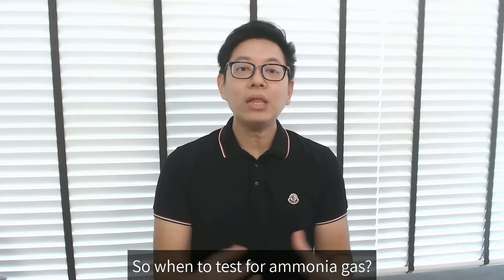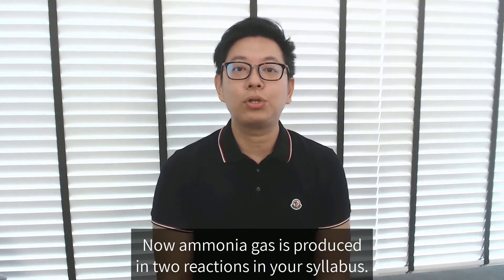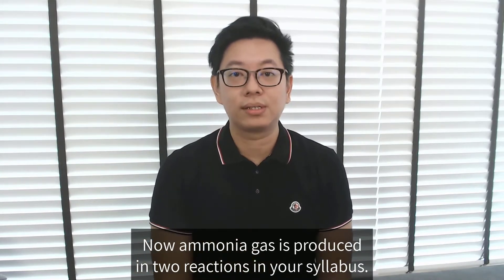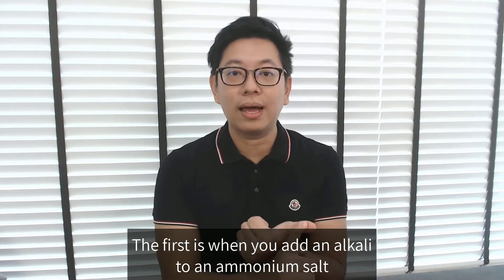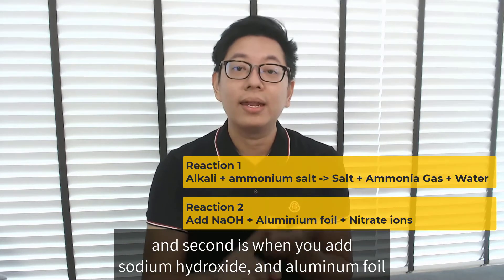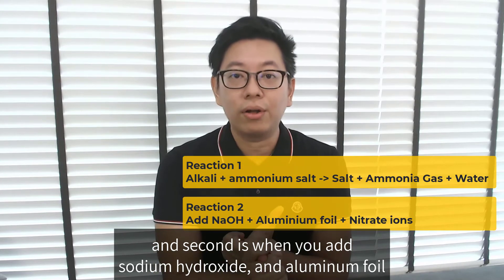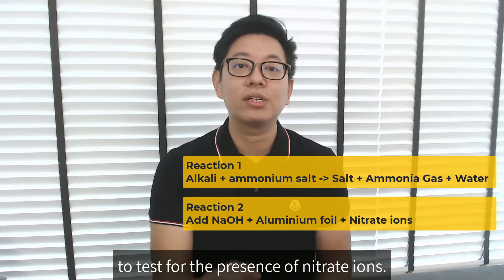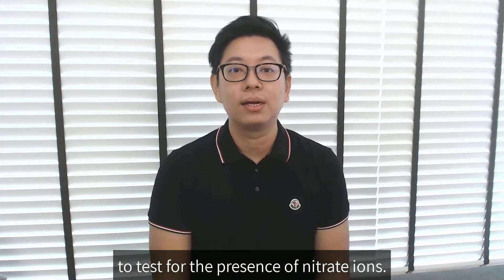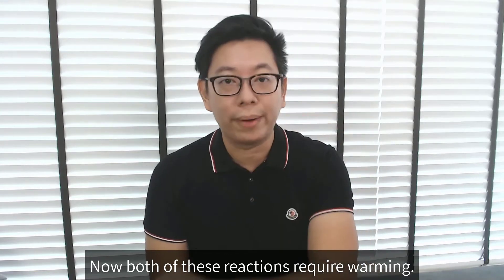So when to test for ammonia gas. Ammonia gas is produced in two reactions in your syllabus. The first is when you add an alkali to an ammonium salt. The second is when you add sodium hydroxide and aluminum foil to test for the presence of nitrate ions. Both of these reactions require warming.